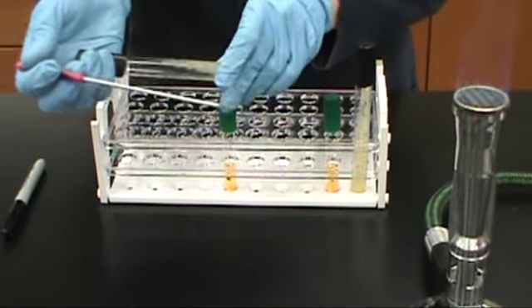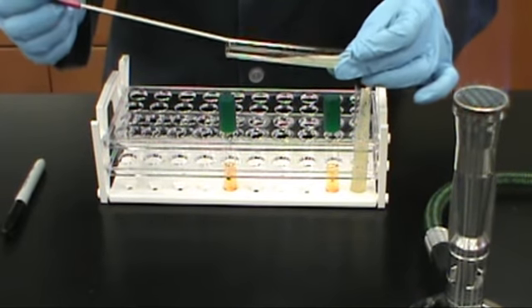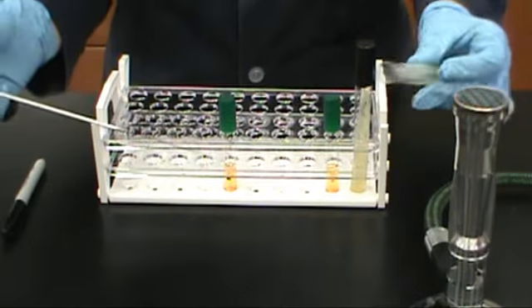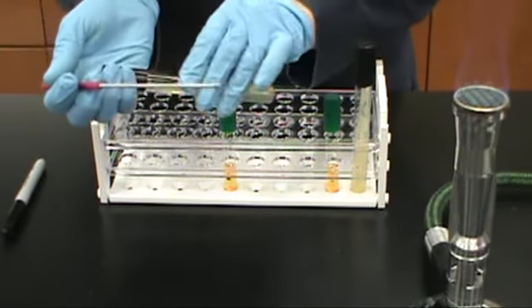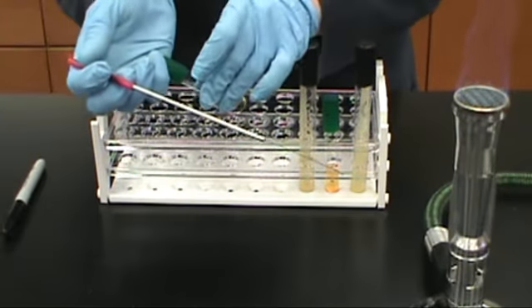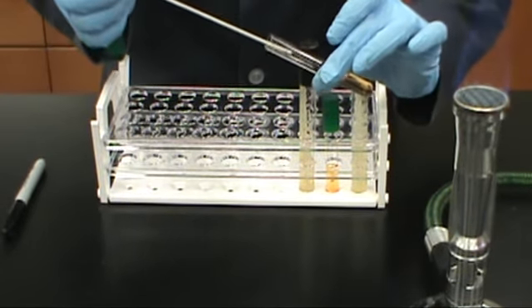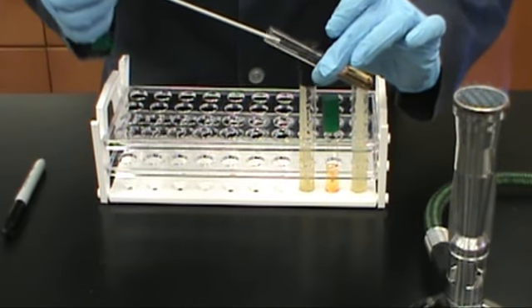When inoculating your tubes, be sure to use aseptic technique and place them in the incubator for 24 hours and no longer than 48. Results are determined by the observation of a color change in the media when the tubes are taken out of the incubator. There is no reagent required for interpreting results in a urease test.